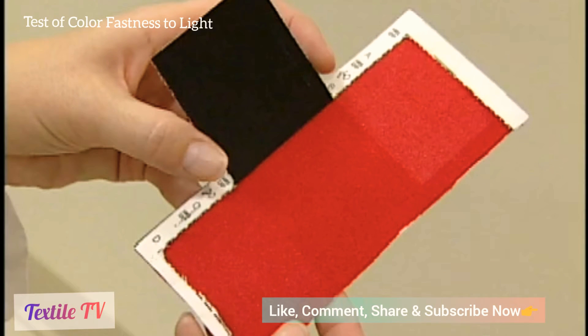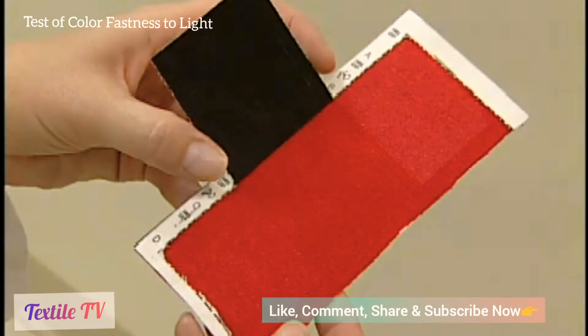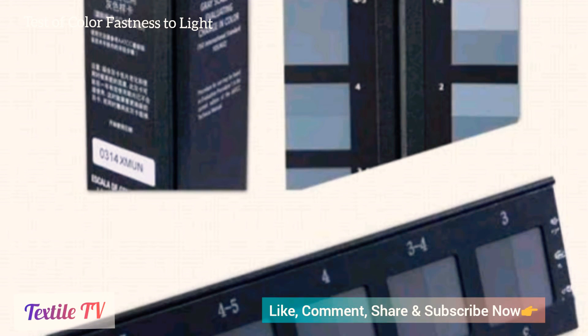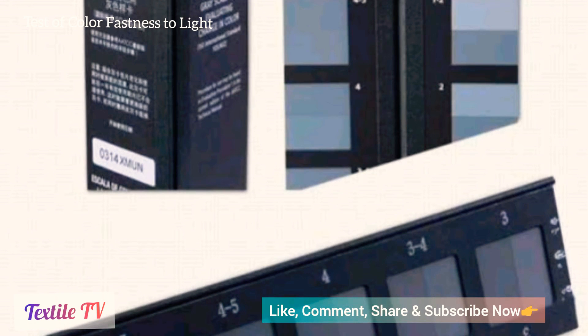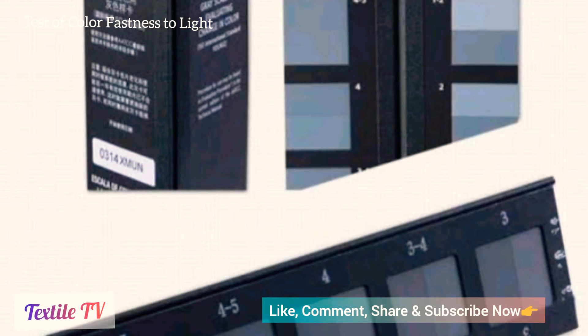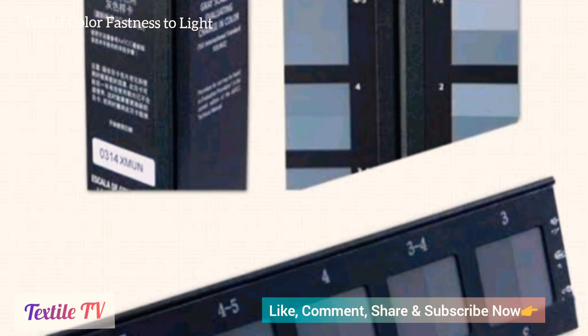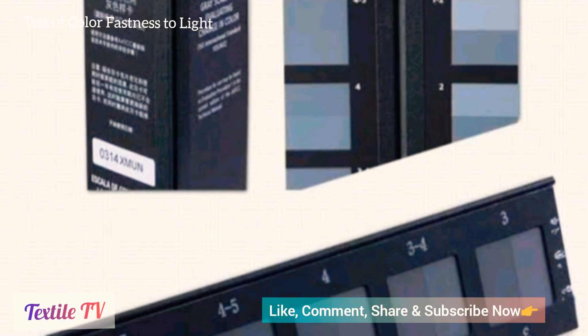Upon completion of the test, the sample needs to be evaluated with a gray scale for color change due to exposure to the light source.